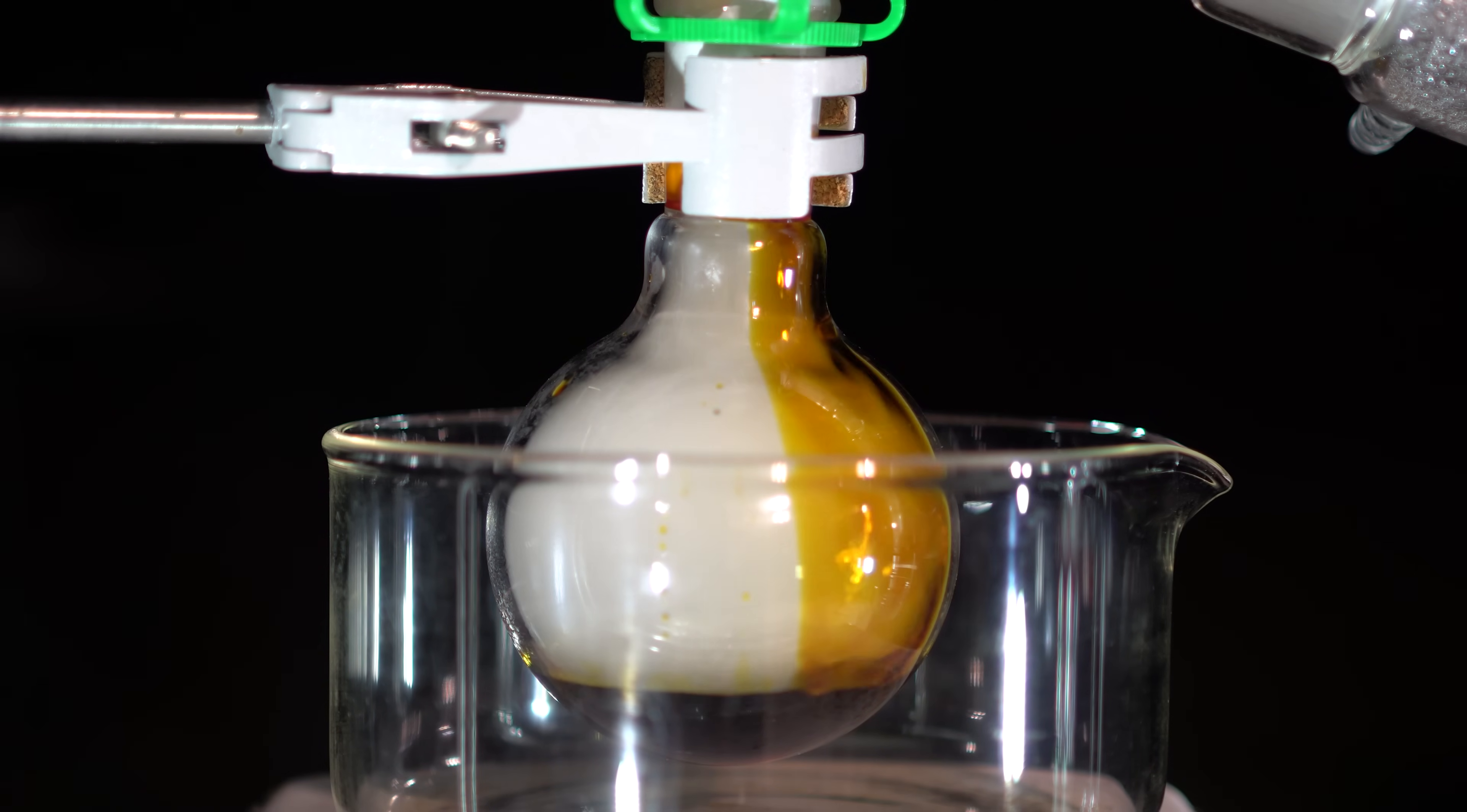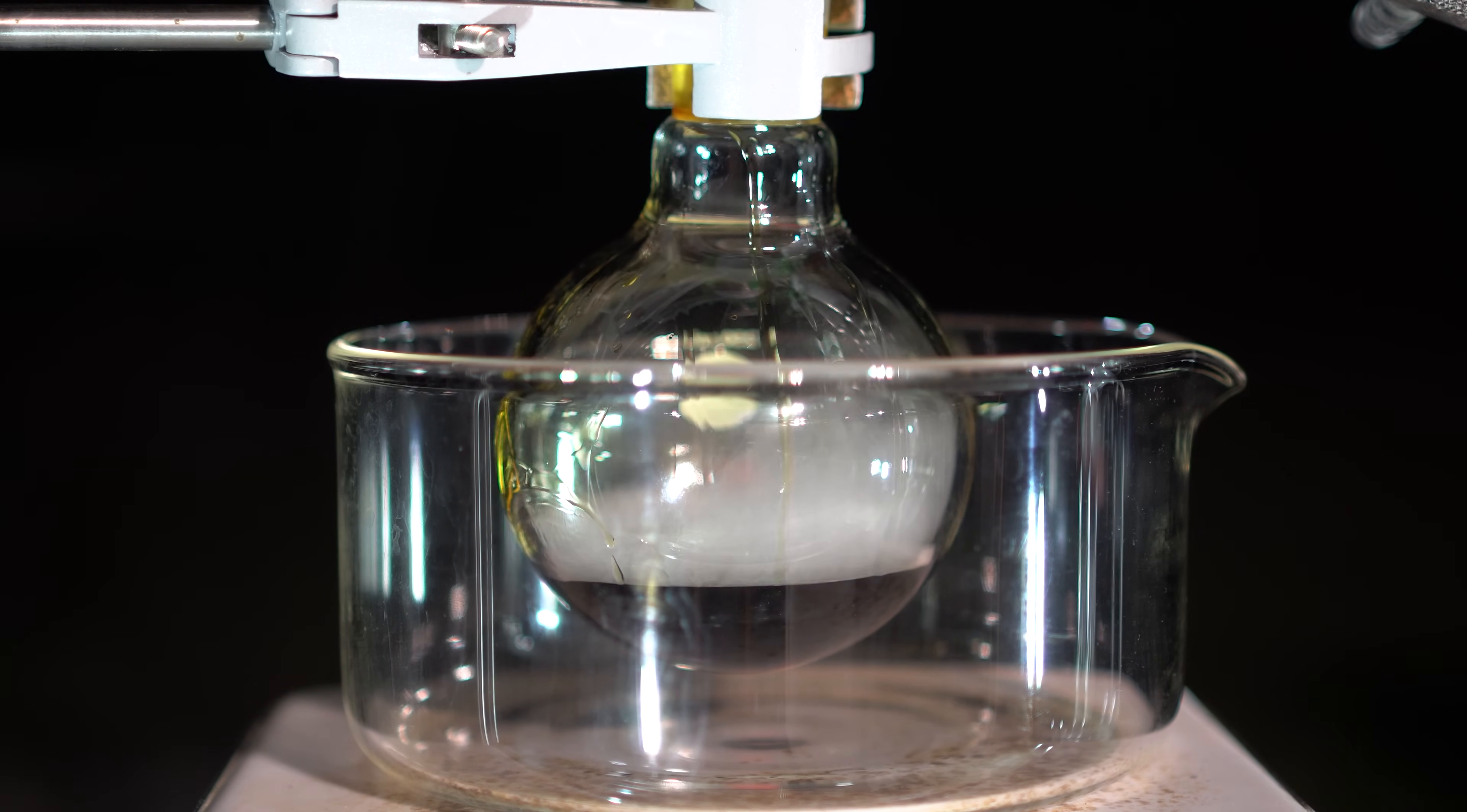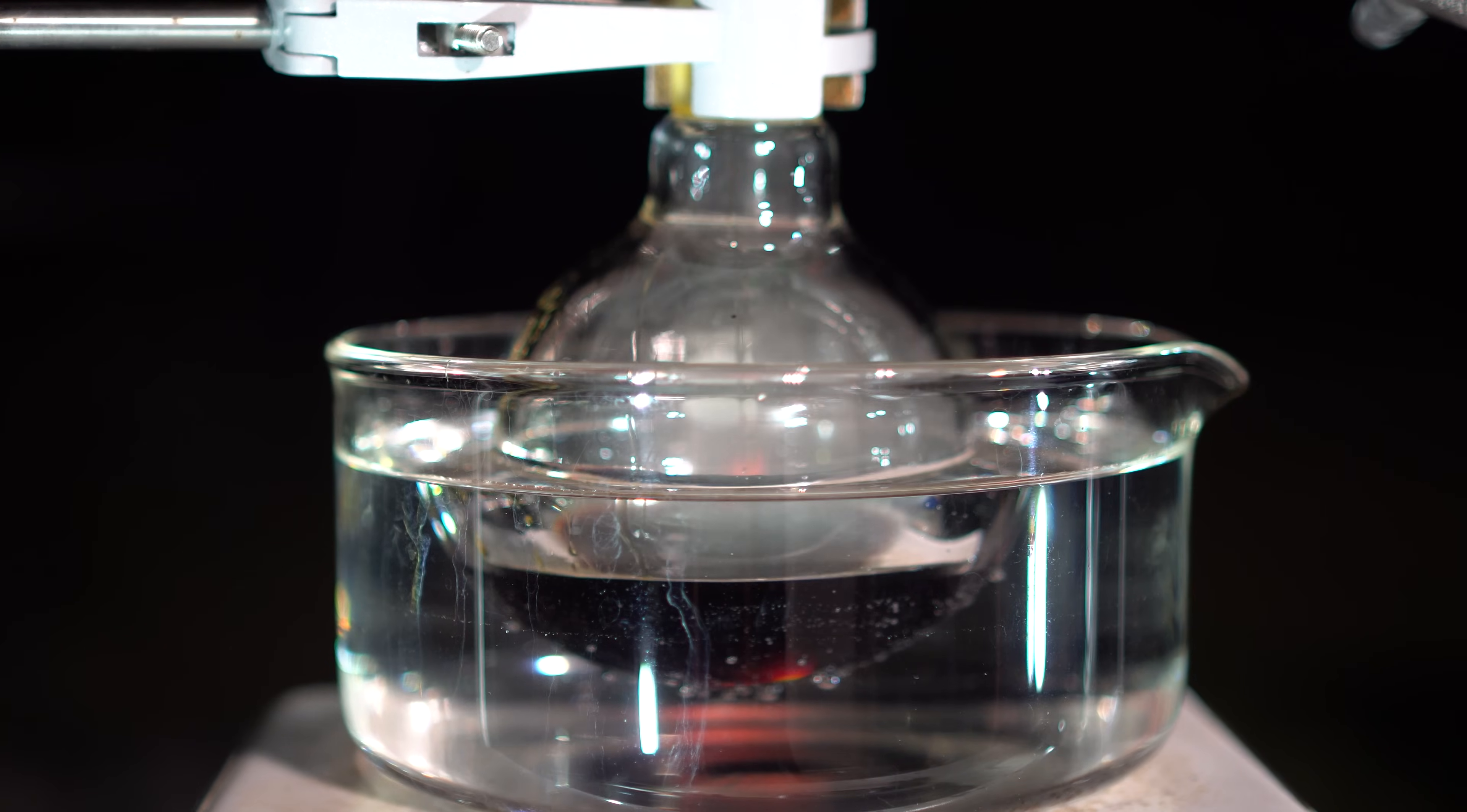Even though I think the acid has a beautiful color, the DEA really doesn't like when people have this. I didn't know how the reaction would proceed, so I added 16 milliliters of methanol slowly to the reaction flask. Upon the addition, it fumed a little bit, so I went to cool the flask down with some cold water. I didn't have any ice, so cold water had to suffice. Did you guys notice that rhyme that I had? M&M better watch out right now.